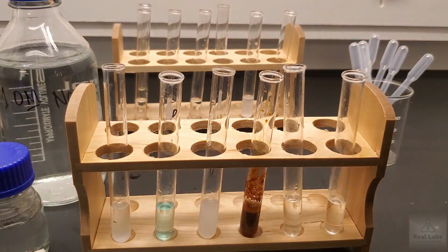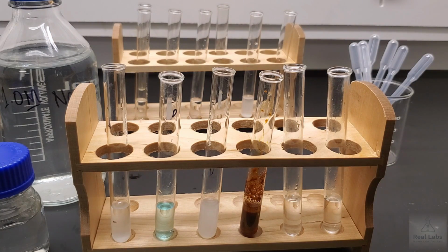So you can change your data, or what you really should do is write it out that you reran the reaction because there was potential contamination of the sodium hydroxide, and in actual fact here's what was seen. So it's better not to just ignore data, it's better to actually write why data was rerun if necessary, and then what the expected outcome was. And so that's what we see here.